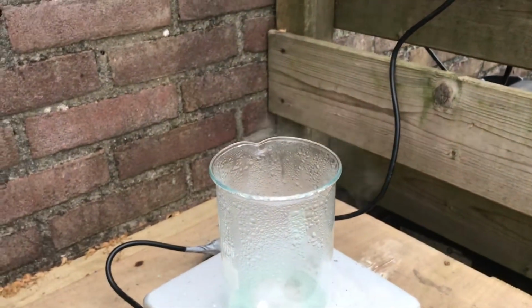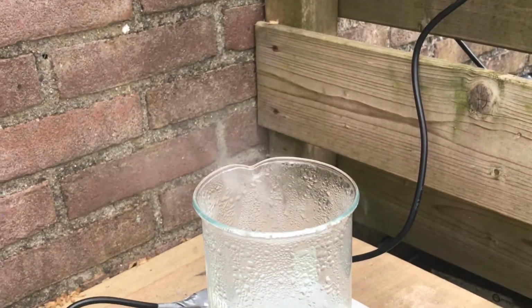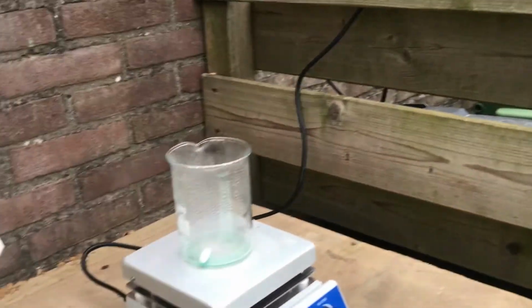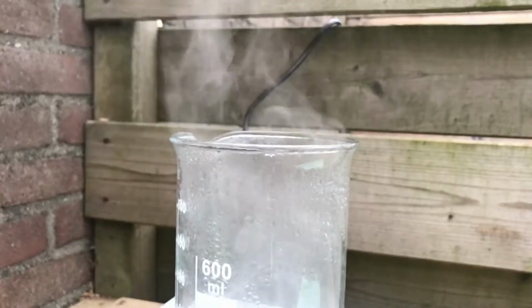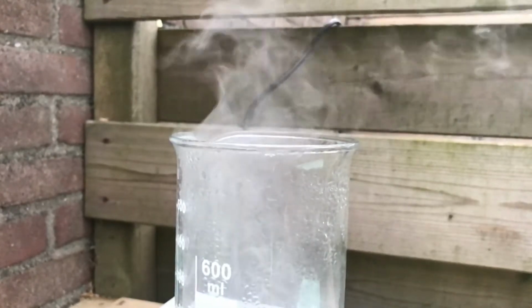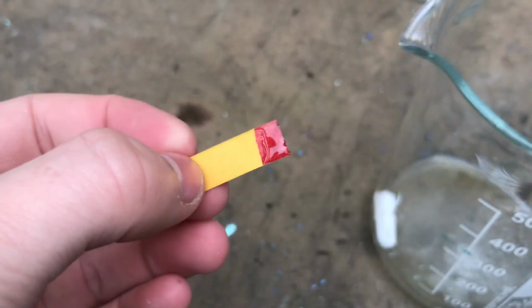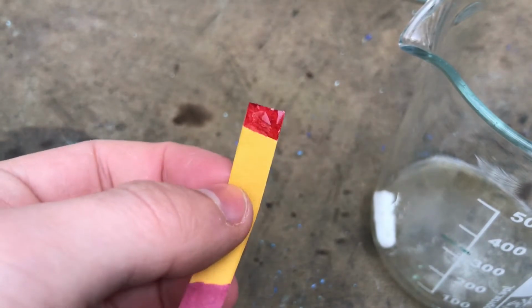Yes, I'm beginning to see the white smoke that sulfuric acid creates when it gets near its boiling point. And I need to stop this right now because my lungs, they are going to die. After boiling for a while, I could see the white acid vapor starting to form. This indicates that the acid is quite concentrated. But just to be sure, I tested the pH again. It turned out to be very acidic, which of course is a very good sign. We have some strong sulfuric acid.